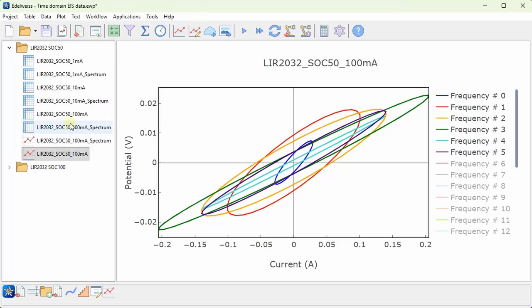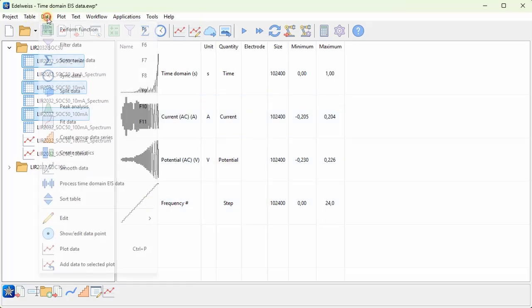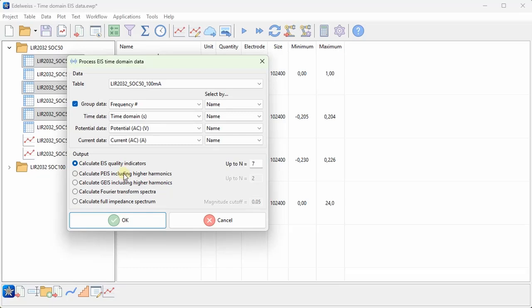So to do this, I will open the table that contains the time domain data, and I will also select the other two tables in the data tree to repeat this data processing for all tables. So I don't have to select any data here, I can just go to data and process time domain EIS data. And now we get this dialog where at the top we can select our data, and as you can see it's already selected for us.